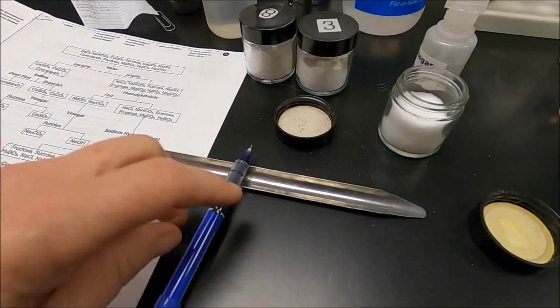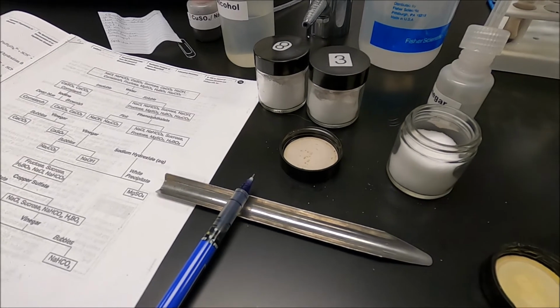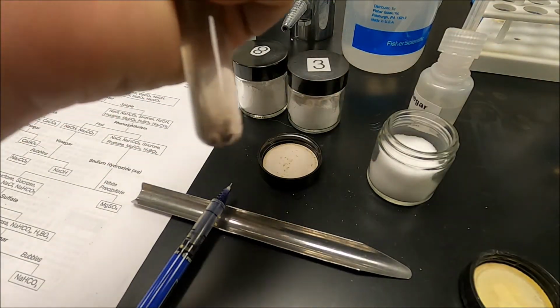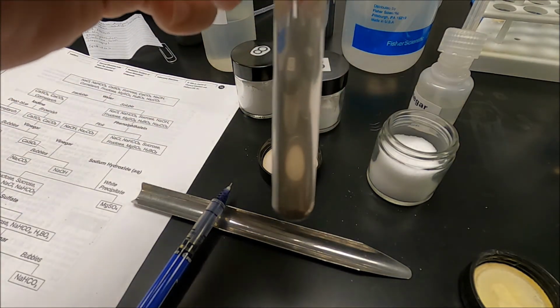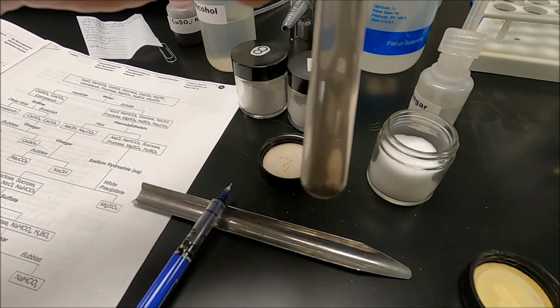So I need to get some hot water. Now I've got a sink that gives me hot water. It'll take it a second to warm up. So while we're waiting on that, let's look at that fructose test. I still don't see any red color in there. I see a little of the black that came from the copper sulfate reduction solution.